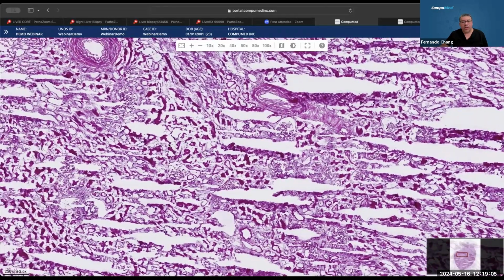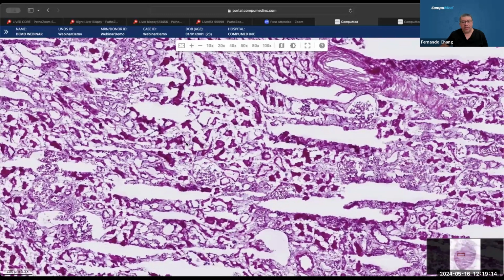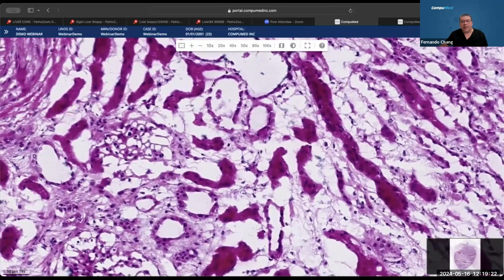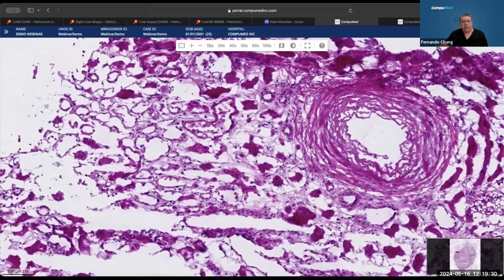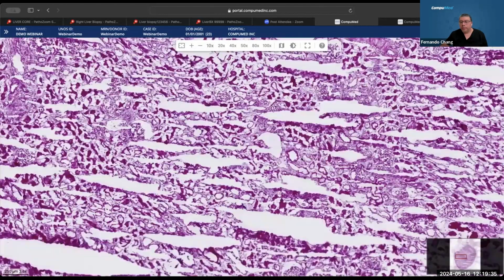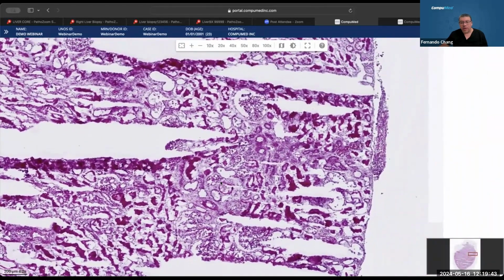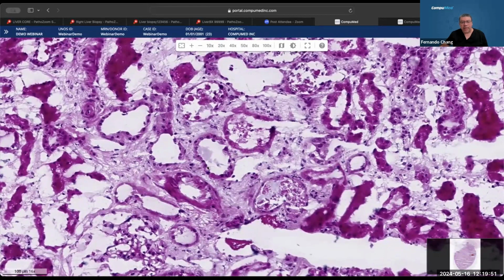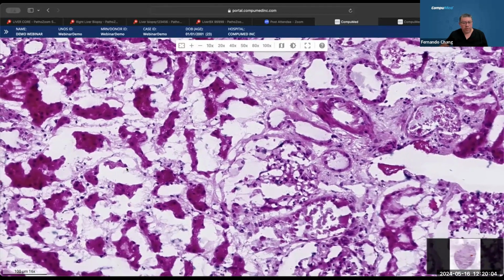Besides that, we can see a lot of crushing artifact here. Freezing artifact, the crushing type, in these tubules in these areas over here. Now we can see some intact, or at least not that compromised, in these areas, but we can see the compression all over the place. It's all compressed, and the shattering. Let's see if we can find an area where there's not that, and the tubuli are more preserved. Sorry if I go too fast, sometimes I do that. It's a little bit less compressed, but look, here it is all compressed in these areas right here. These tubular areas, all compressed, it's like an implosion in this area.